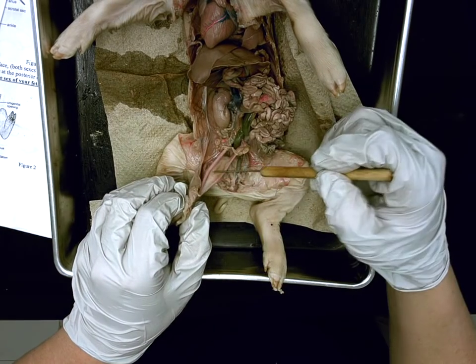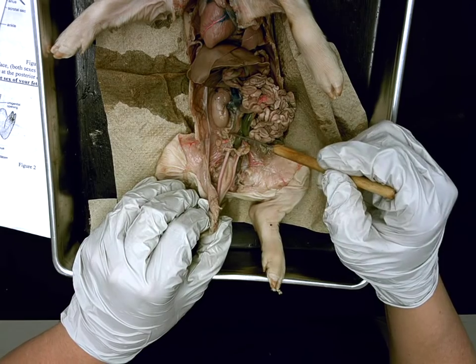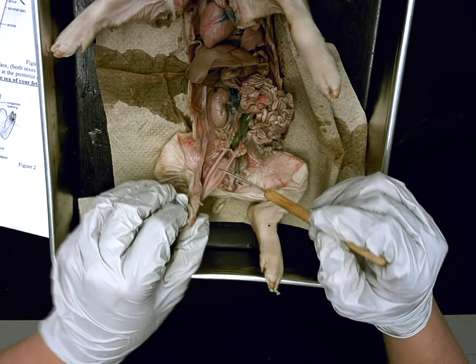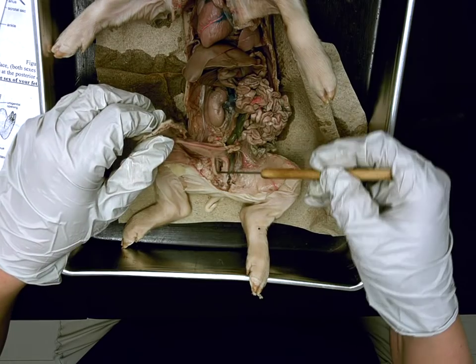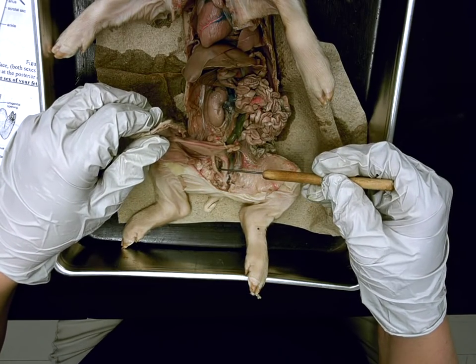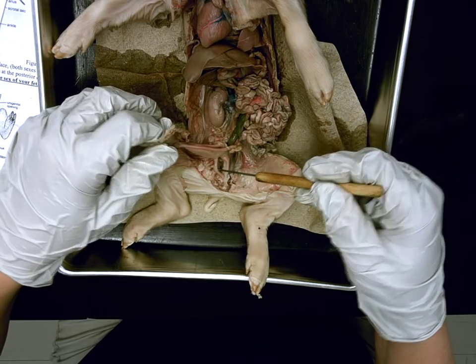This is a female pig, by the way. So: kidney to ureter, ureter to bladder, stores urine. Bladder then drains to the top tube in a female — which would be? Urethra. Keith, function of the urethra? Exit point for urine. Exit point for urine. Correct.